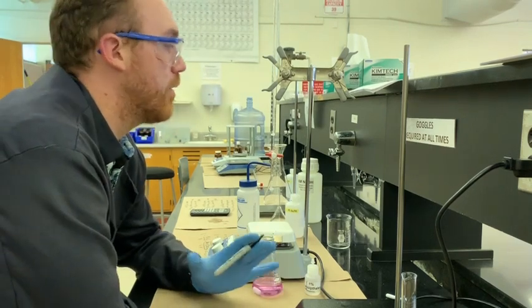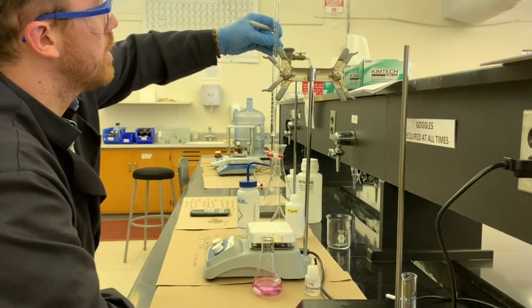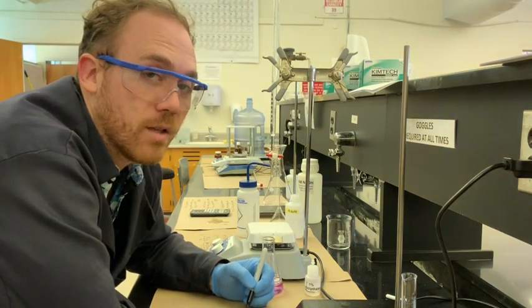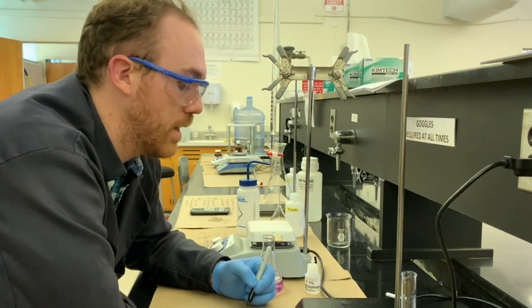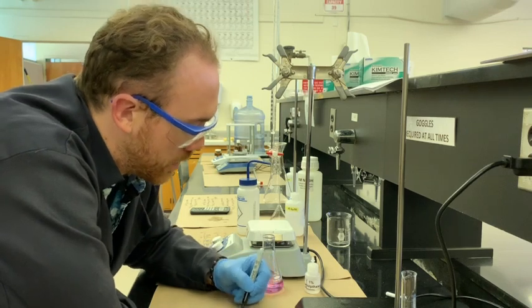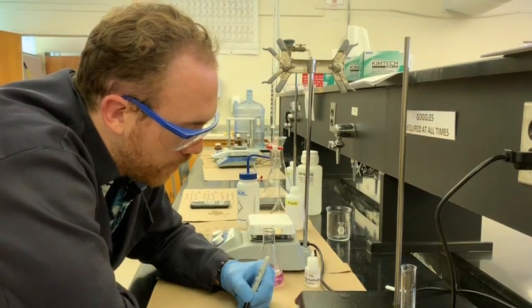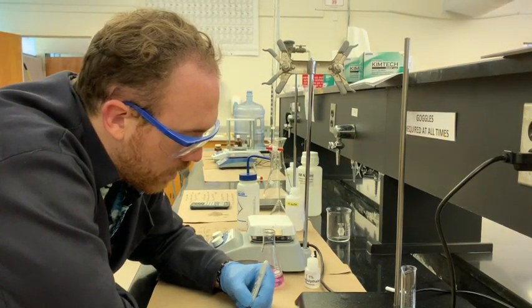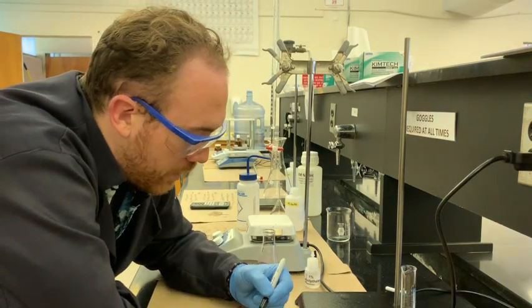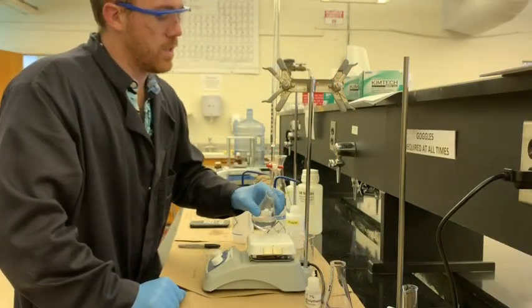And we have a rough estimate of what the actual molarity of the NaOH in this solution is. So the molarity will be calculated by using the volume of the total NaOH dispensed, which is going to be 15.29 minus 4.20. So the total volume dispensed makes for an easy calculation. It's going to be 11.09 milliliters.